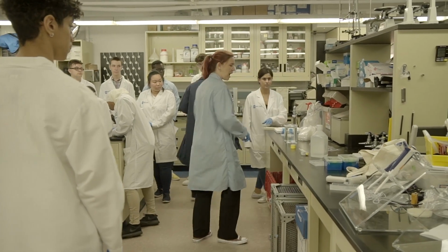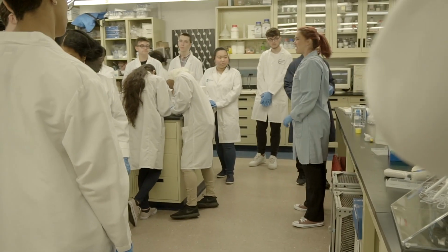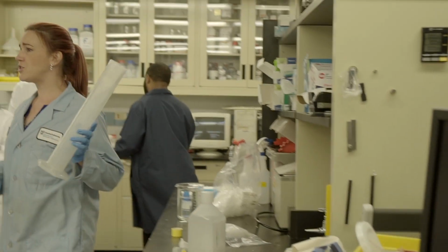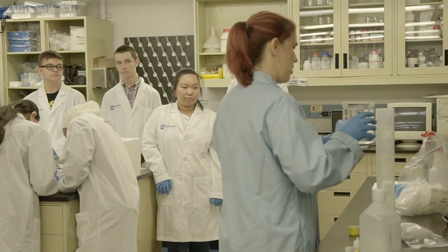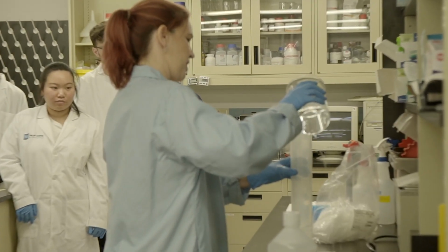And what am I going to put in first? The water or the TAE buffer? Water, right? Because that's easier if I mess up to get rid of and get more. And what am I using to measure it? Right? Because that's my most accurate for large volumes. And what am I looking for when I pour this in, besides not spilling it all over?